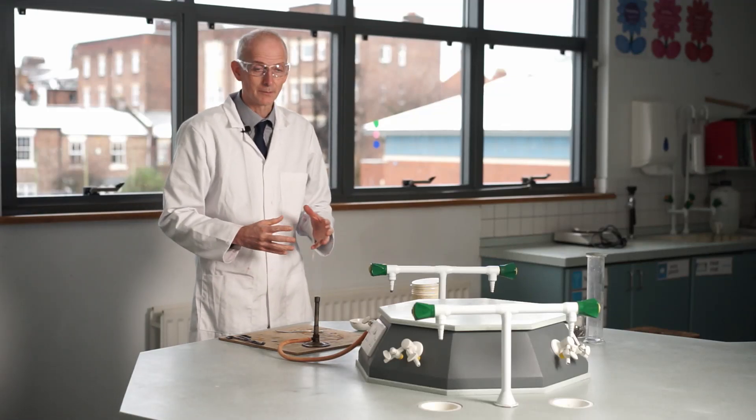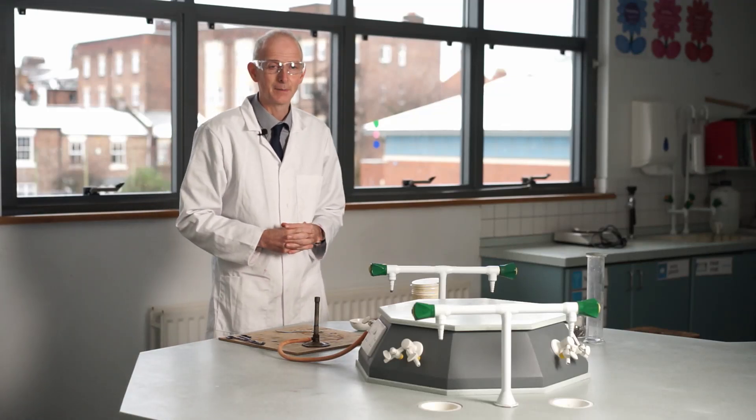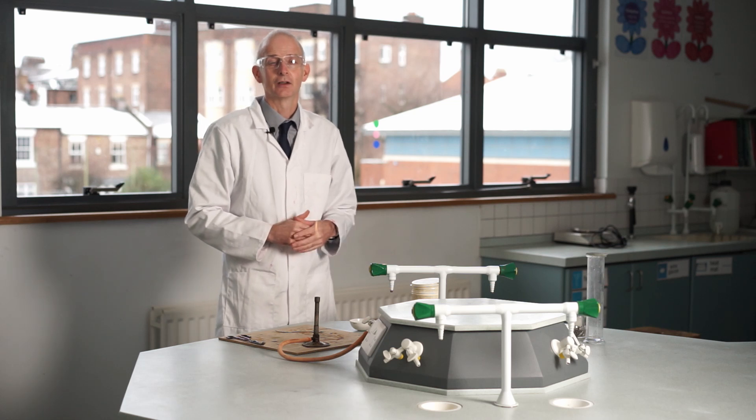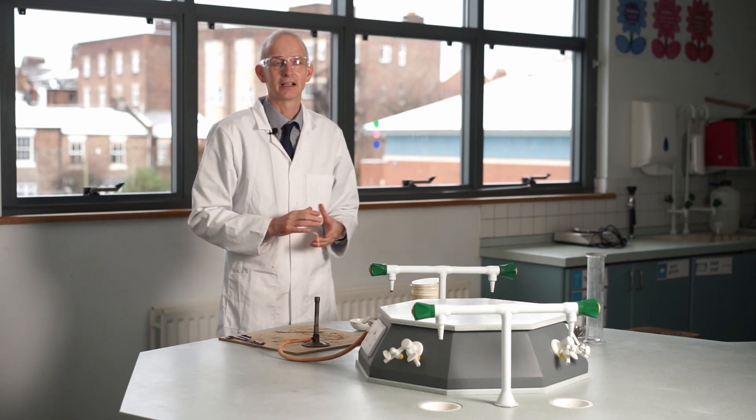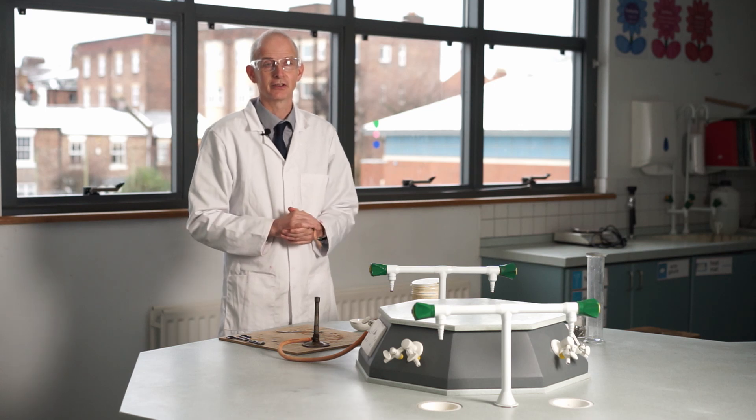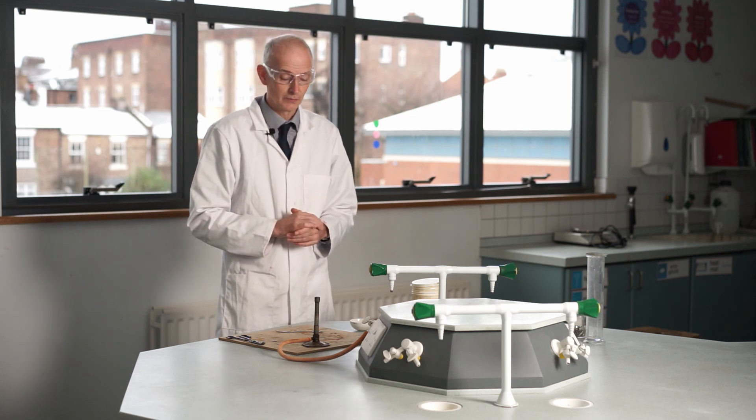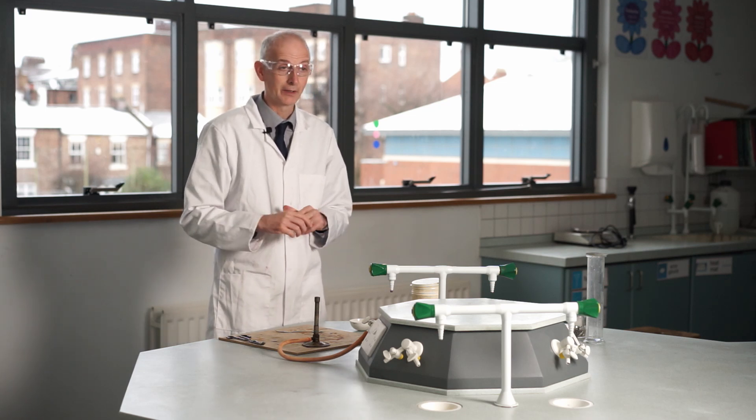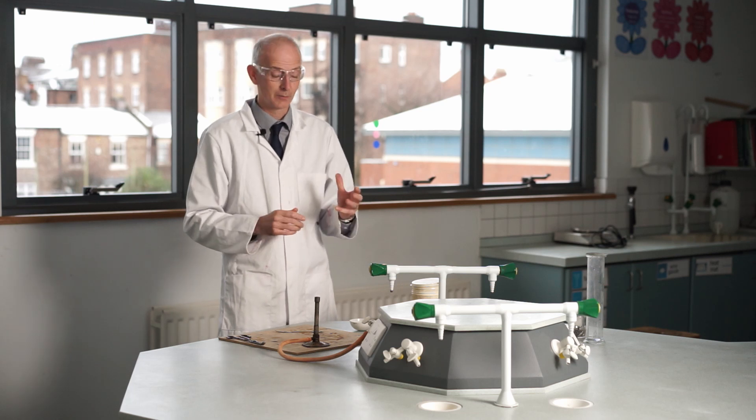We're going to show you what happens when you heat various metals in air. Remember, air is a mixture of different substances—it's 20% oxygen, that's the reactive bit, and most of it's nitrogen which is unreactive. So what happens when you heat these things up? Well, they react with oxygen in the air if you get them hot enough.